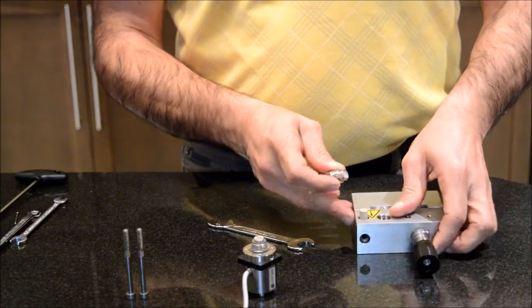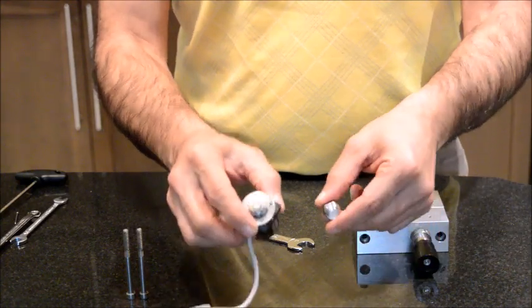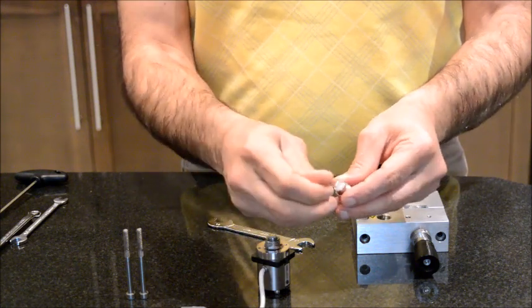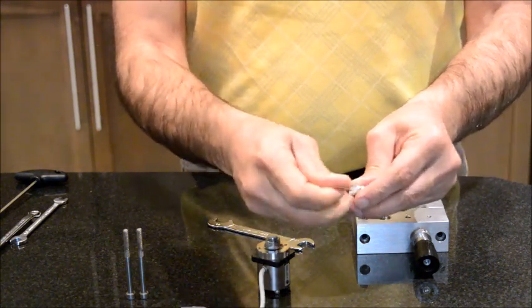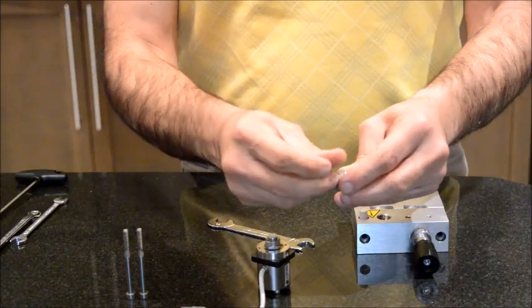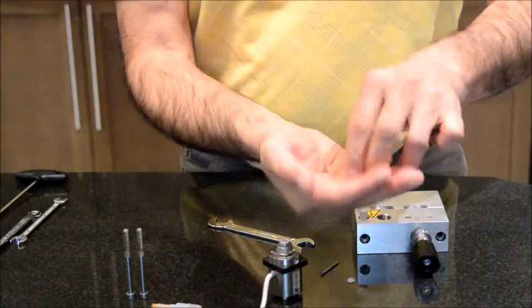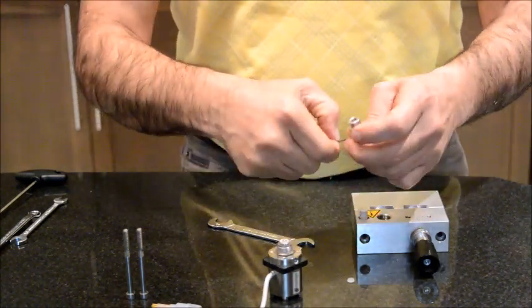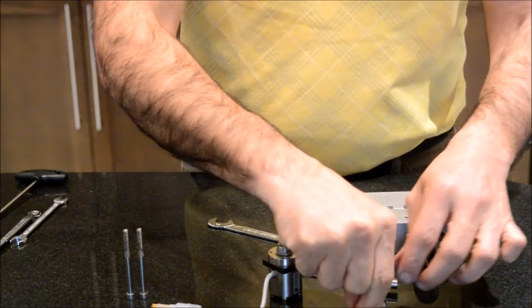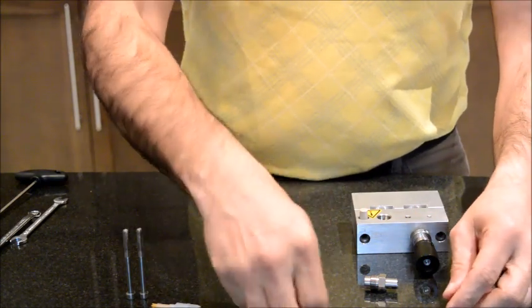Now, as I said, if you see that your pump is working but there is no flow, or if the flow is fluctuating, it's due to these valves. And there's a part here for the outlet valve. I'm going to use a needle, you have to remove this piece of plastic. And there is a part inside that you need to replace. So that's a replaceable part, a consumable, you can buy them. So you rebuild your outlet valve.